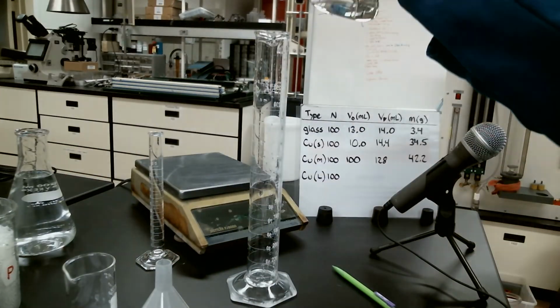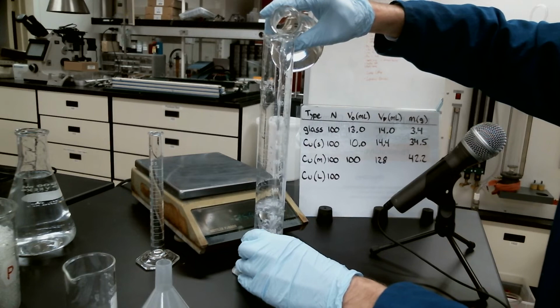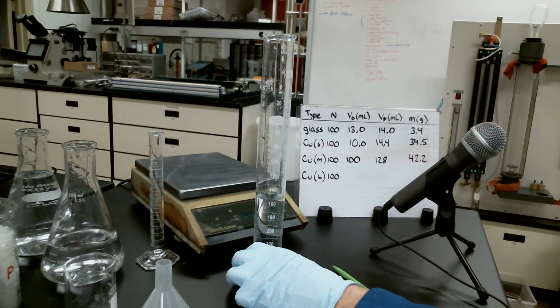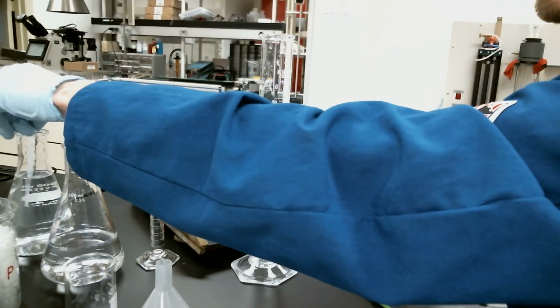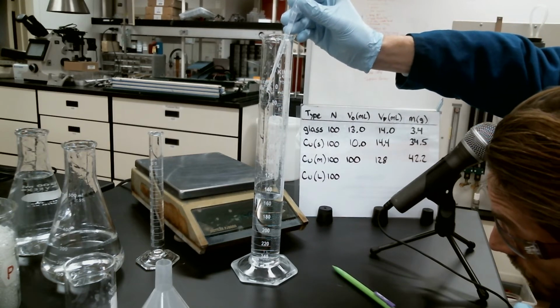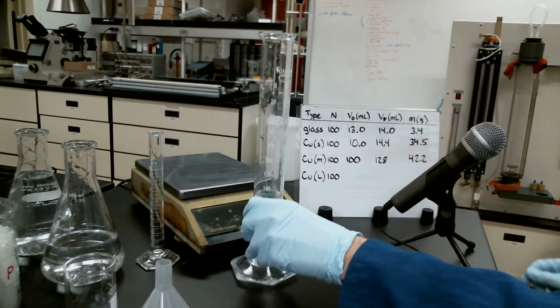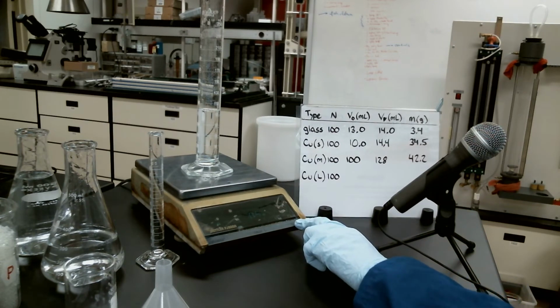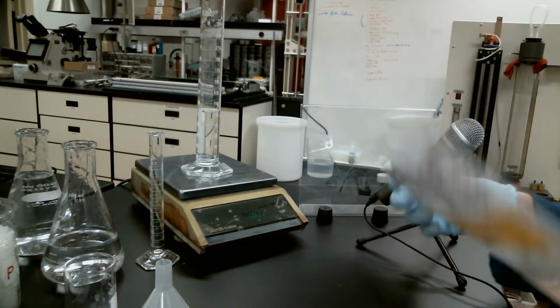And now we're just going to refill this with a little bit more water so that we can move on to our large copper spheres. That's pretty close to 100. Let's see what we're doing, just by coincidence. We need a little bit more to get us up to 100. There we go. That's right up at 100. Put that back on here. We'll go ahead and tare that out. I will write down that we have 100 mils to start with on here.